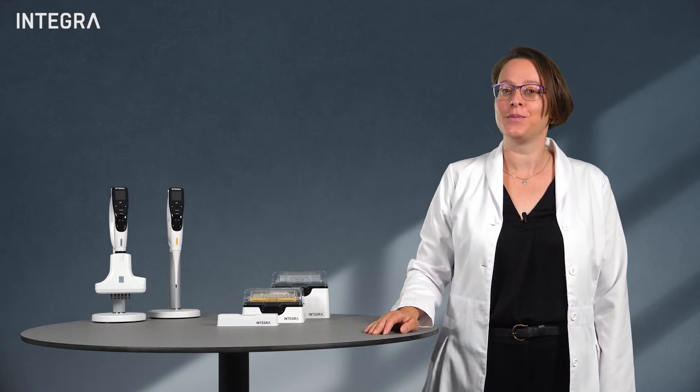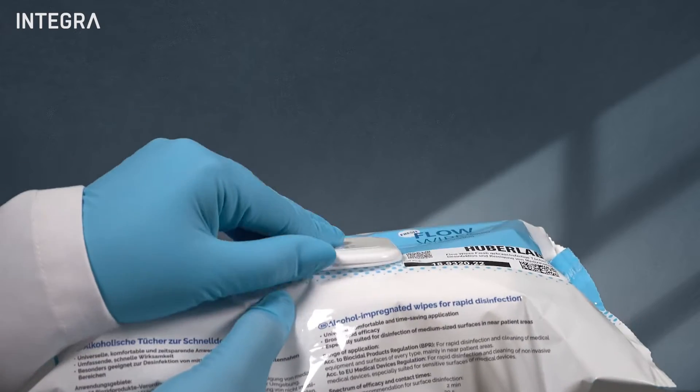This ensures that no contaminants can enter the pipette. Regular cleaning is also recommended to keep your pipette operating at optimal performance.